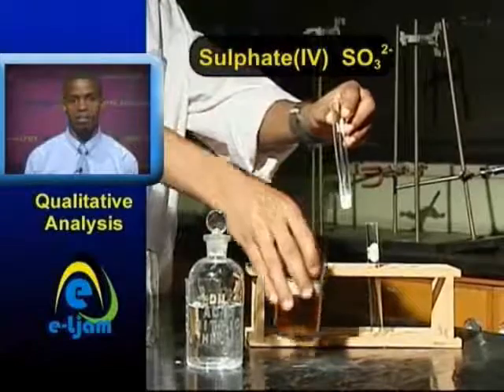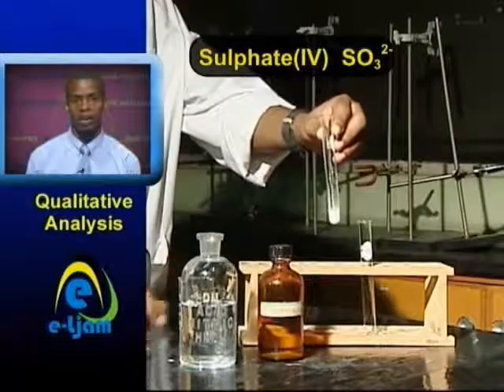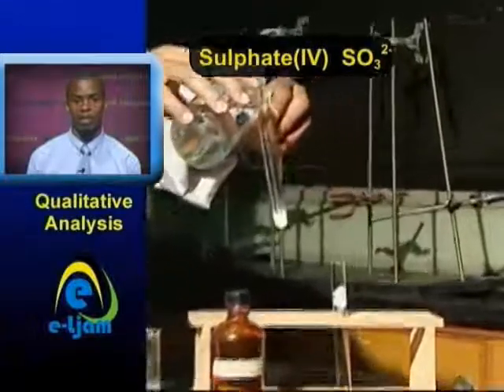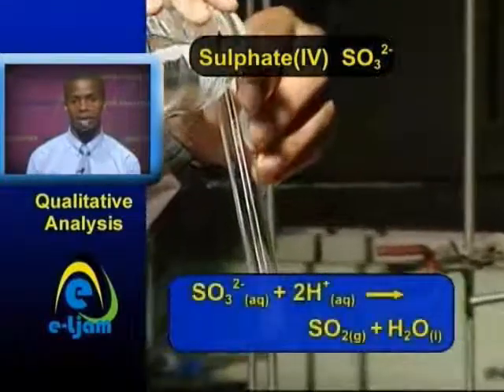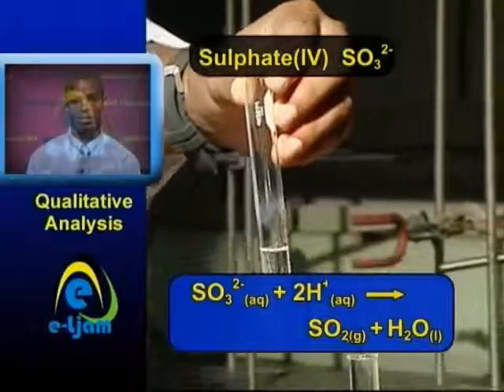Sulfite. Sulfite precipitates from solution as white barium sulfite on addition of a soluble barium salt, for example, barium chloride. The precipitate reacts with dilute hydrochloric acid or nitric acid to produce sulfur dioxide.